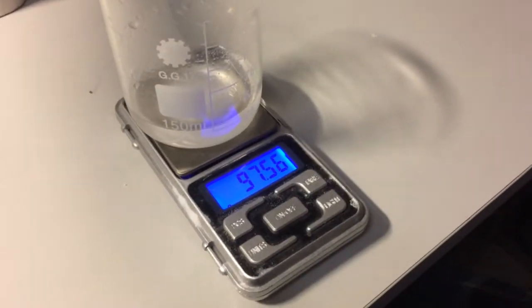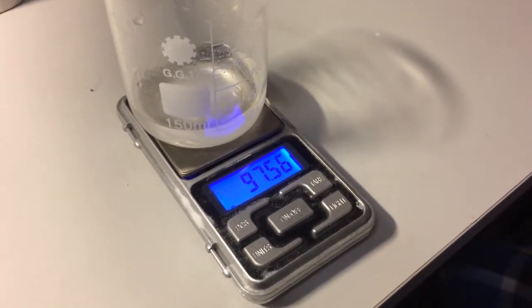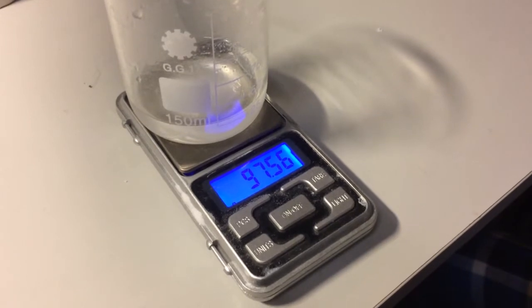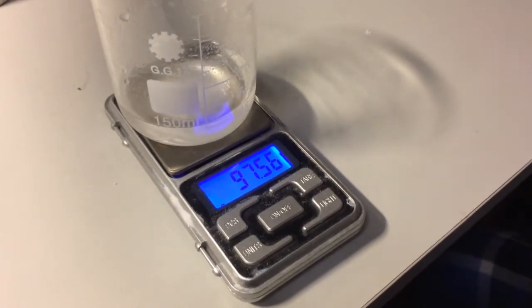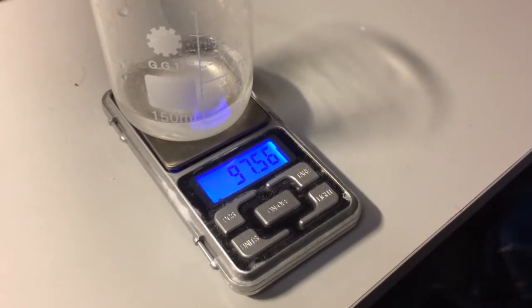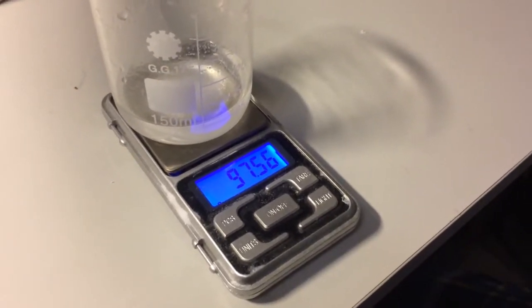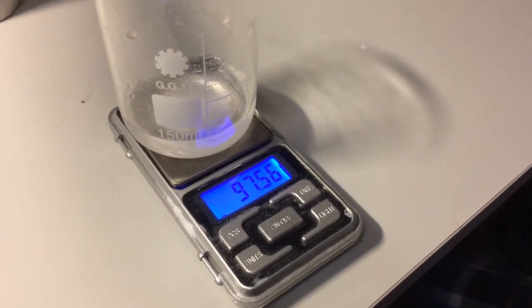Now that the reaction has taken place the weight is 97.56 grams. It is lower than 97.84 grams because some of its mass was taken away with the gas bubbles.